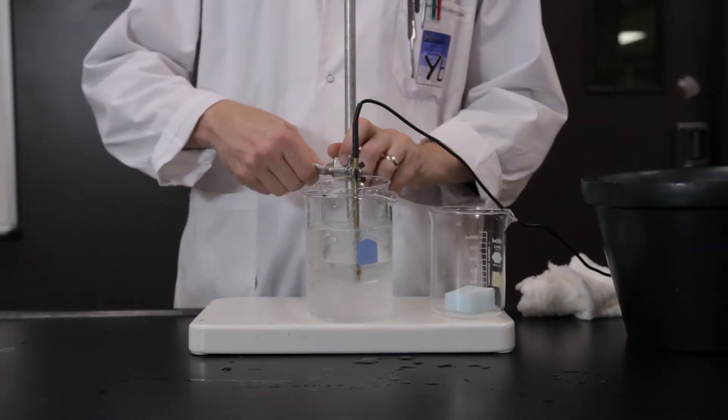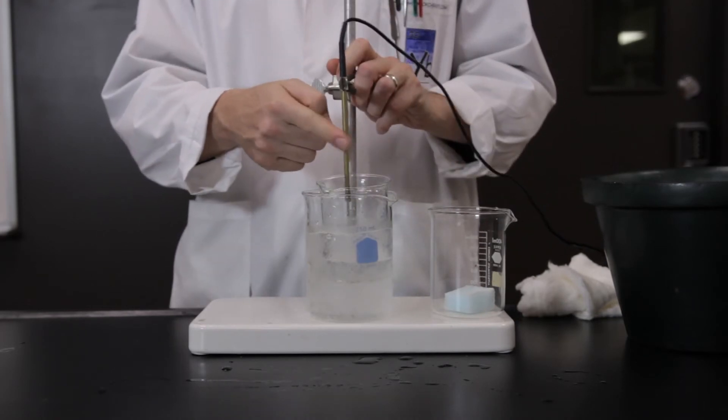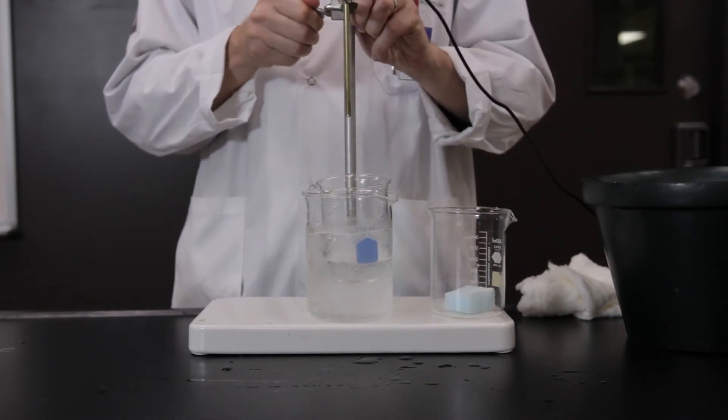Once the sodium hydroxide solution has cooled back down to room temperature, transfer it back to the calorimeter and weigh the apparatus.